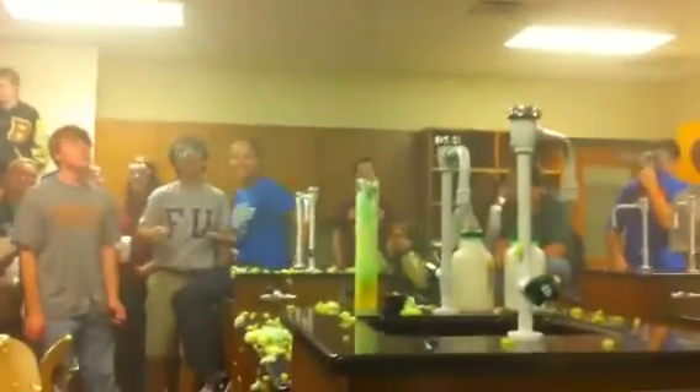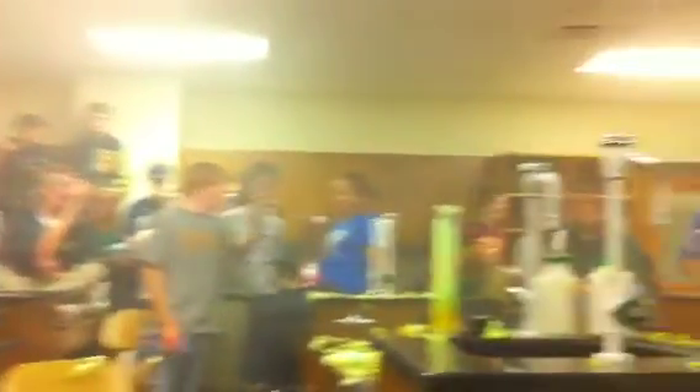Yes, elephant toothpaste just got really cool! Oh my goodness, yeah, I told you. That was cool. You're welcome. Coach Powers runs to the arena. He's still going to be good.